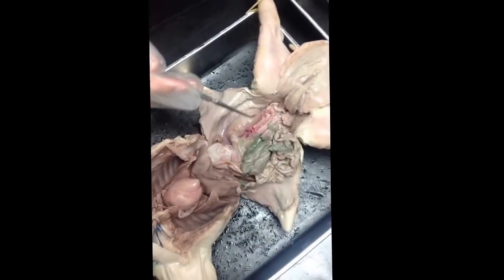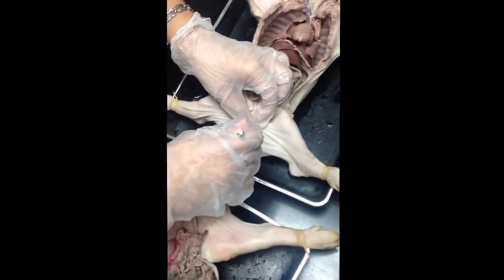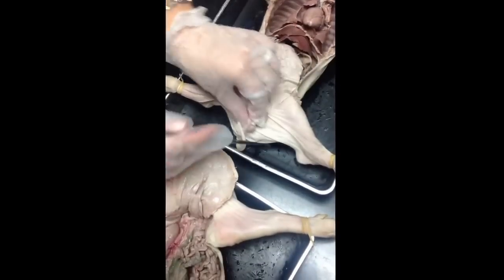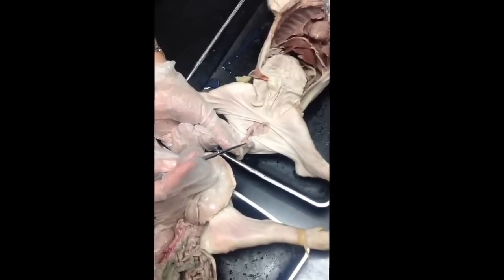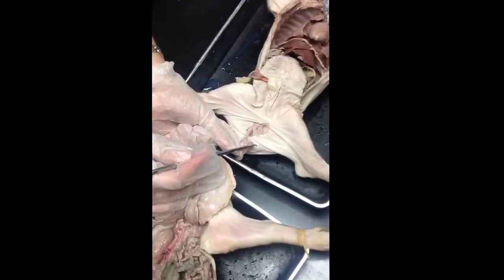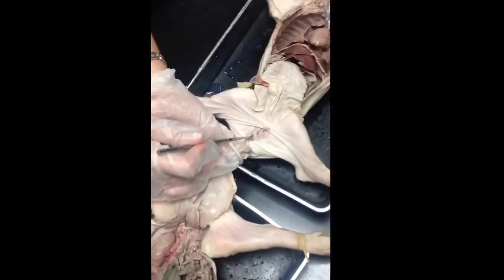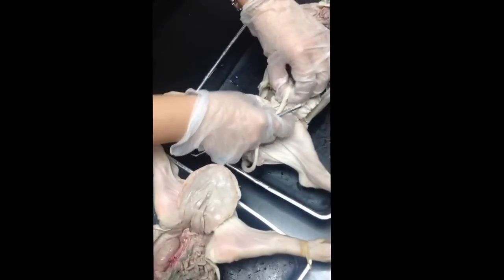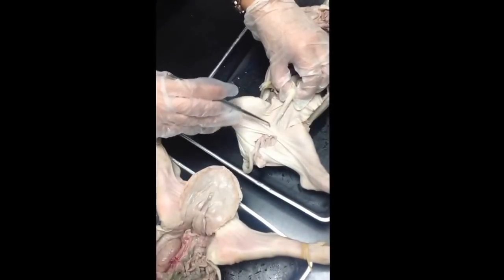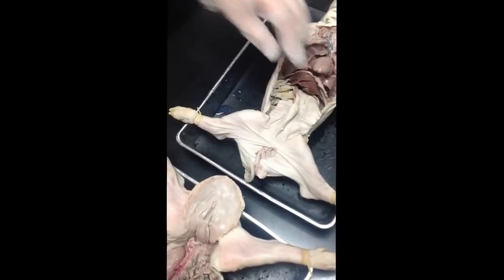For the male, on the other hand, so let me scoop it out. So within the scrotal sac, you would have exposed this bean. That's the testes. The cap around the testis is the epididymis. This tube that leads from the epididymis is your ductus deferens or your vas deferens. The penis runs ventrally. It's underneath the skin here. You can sort of see the tube. And this hole is the preputial orifice. And that's it.